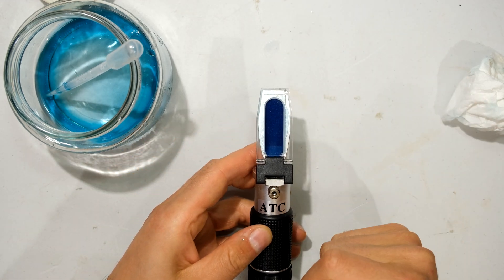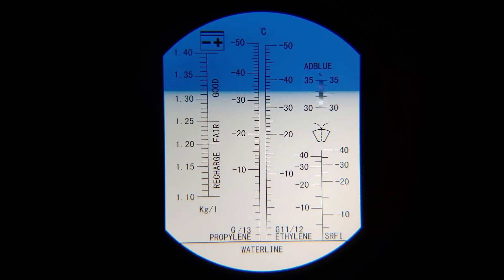I'm going to let that stand for 30 seconds. With a 50/50 percent solution, we can see the temperature reading is at minus 36 degrees centigrade — that's the freezing point of the solution. But to confirm how much antifreeze to distilled water that represents, we need to go back to the conversion table or graph.